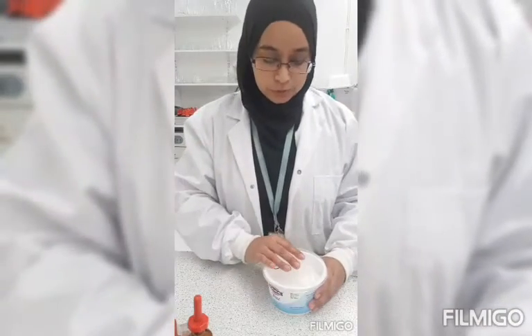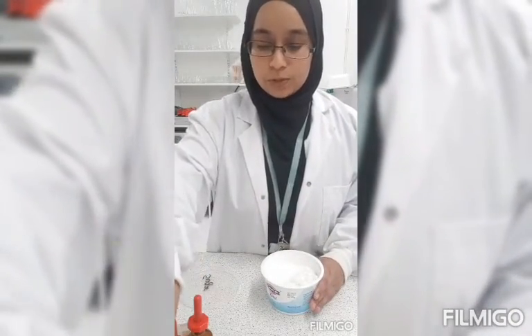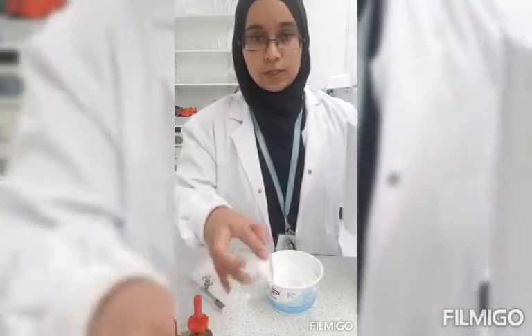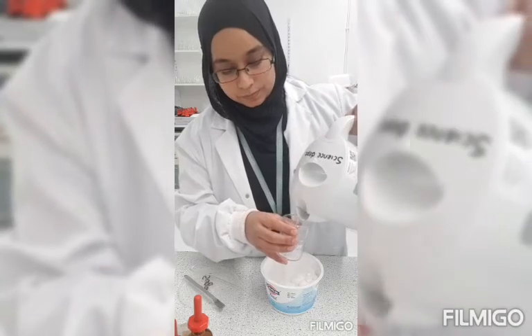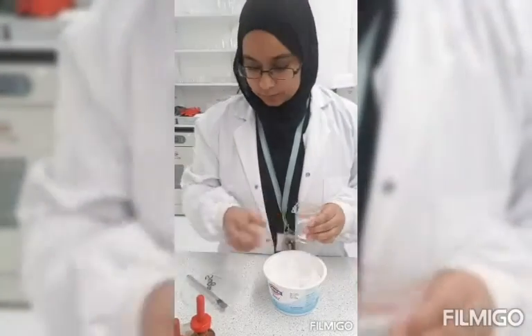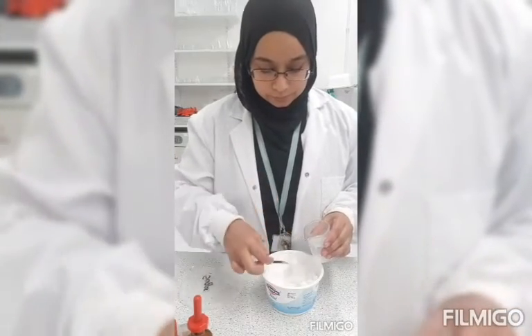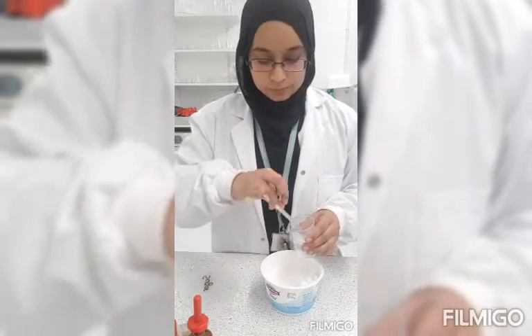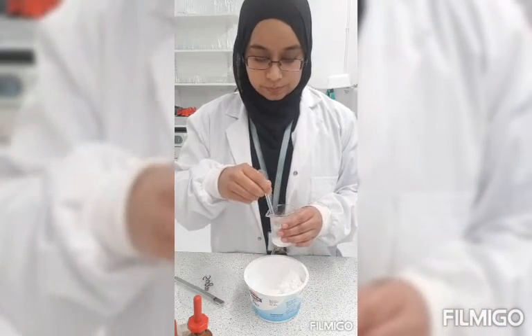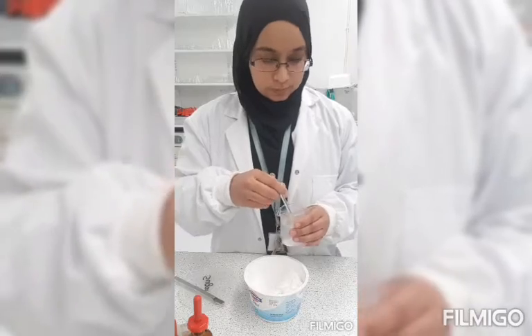With sugar, all we need to do is dissolve it in some water. Use warm water because it will be easier to dissolve. So in another beaker, put some water in, add a couple of spatulas of sugar, and give it a stir.